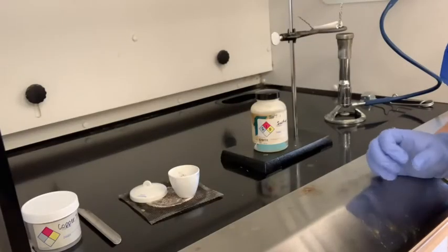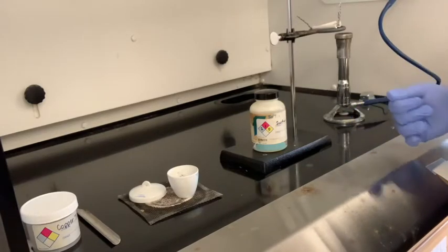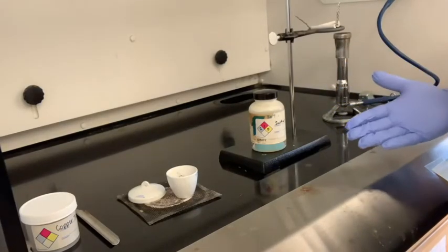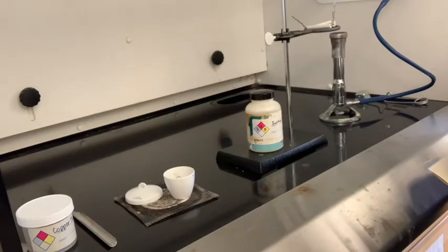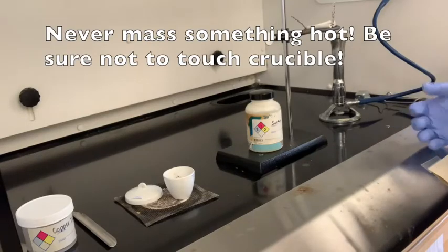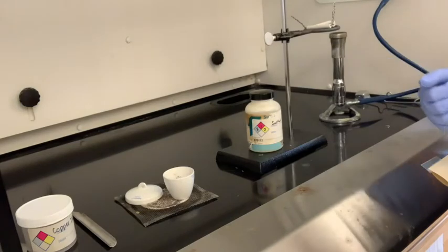It's been a while since we cleaned our crucible — I left it here in the hood to cool. To judge whether or not it is cool enough to take over to the balance, even though I have gloves I still don't want to touch it: one, in case it's still hot and burns me, and two, there might be stuff on my gloves that I don't want on the crucible. I'm just going to put my hands around it, and if it's radiating a lot of heat that means it's not cool enough. Mine has cooled off completely.